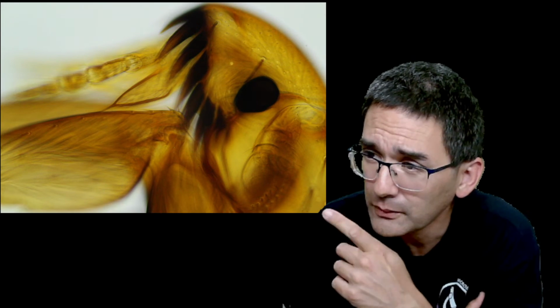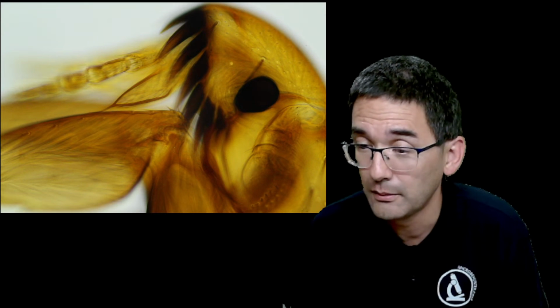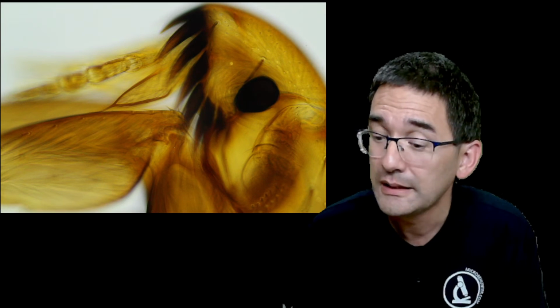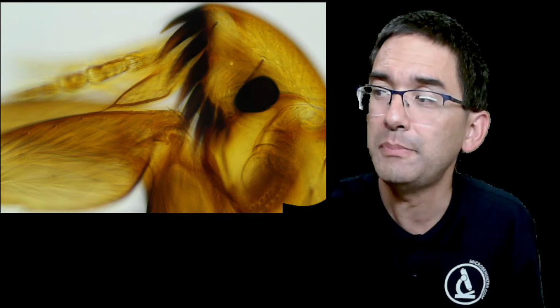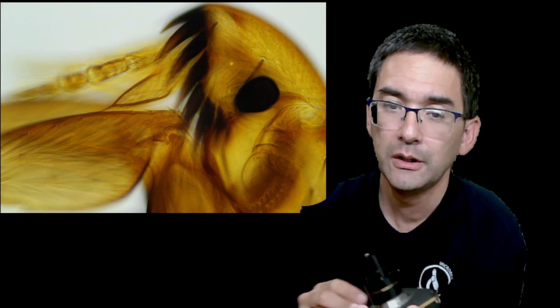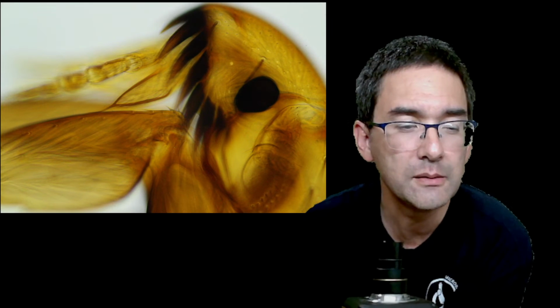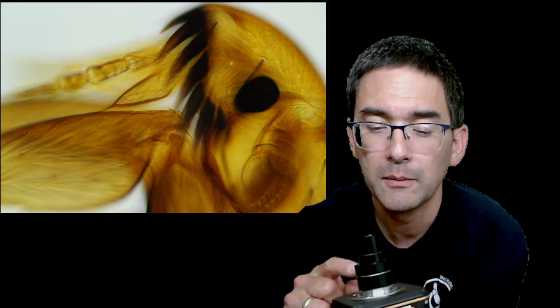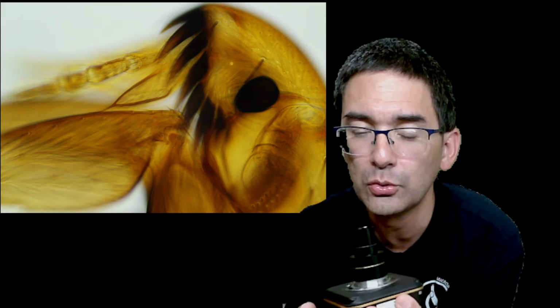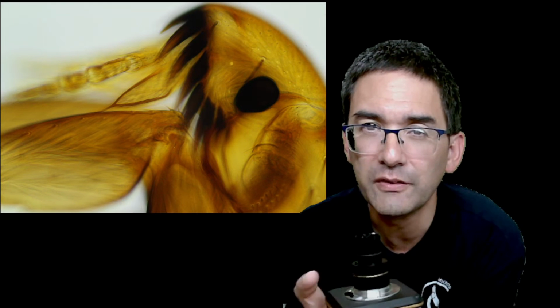So if you want to connect a DSLR or a mirrorless camera, then that's certainly a thing to experiment with. But otherwise, I would say that in most cases those USB 2 cameras, like I have over here, like I showed you already, will be fine. But when I connect those, because of the relatively small sensor size and especially because of the slow USB 2 connection, sometimes you don't get very good video all the time.